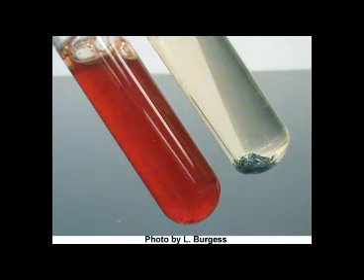The tube on the right did not change color after the reagents A and B, so zinc powder and hydrochloric acid were added. The tube still did not change color, indicating that no nitrates or nitrites are present in the tube, so the organism grown here produced both nitrate and nitrite reductase.